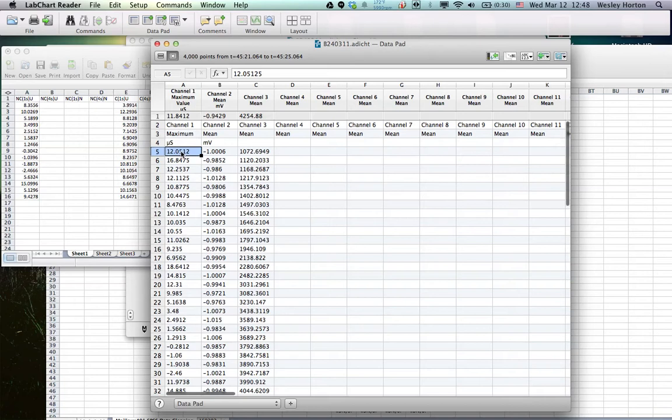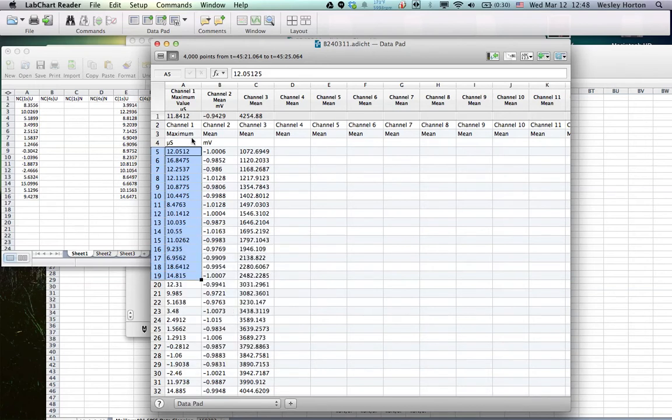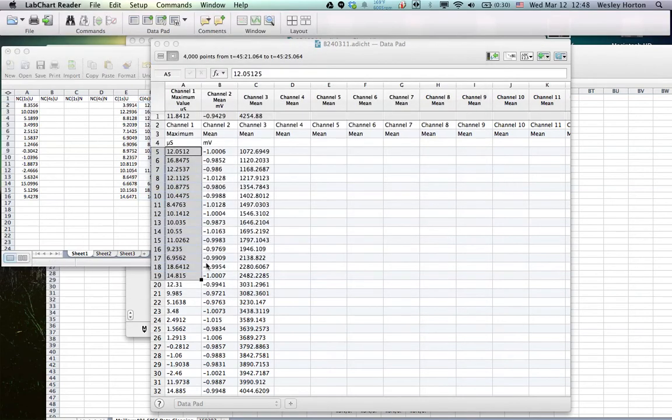All right, so I'm going to go ahead and grab the first 15. This is going to be unpleasant, 4 seconds. First 15 are going to be sibs. And the second 15.